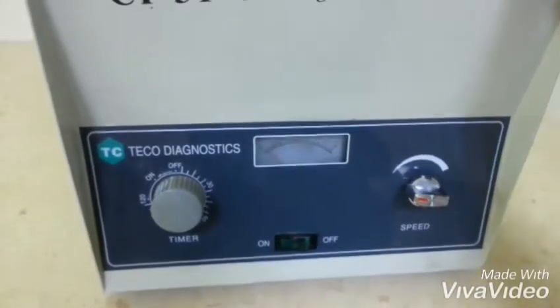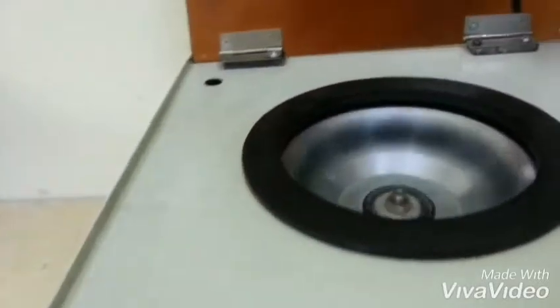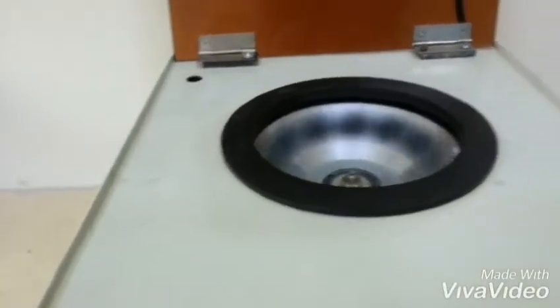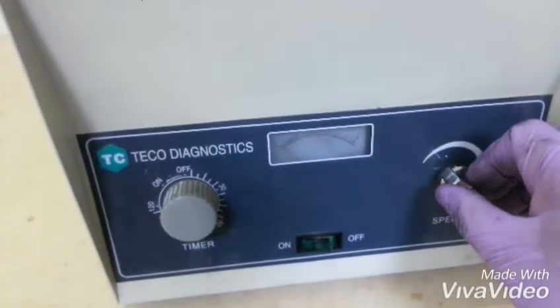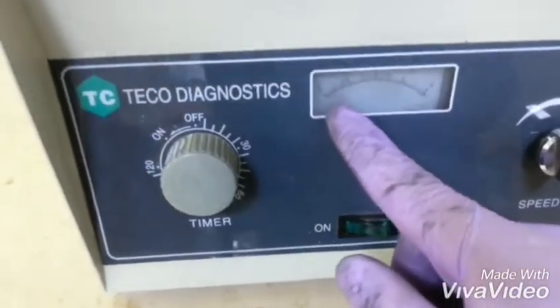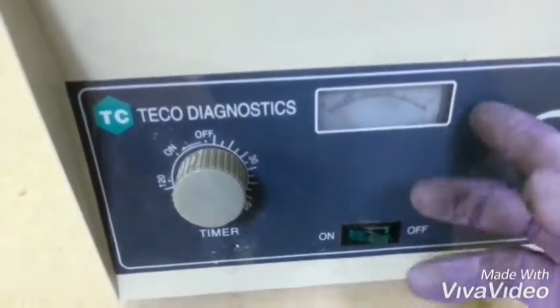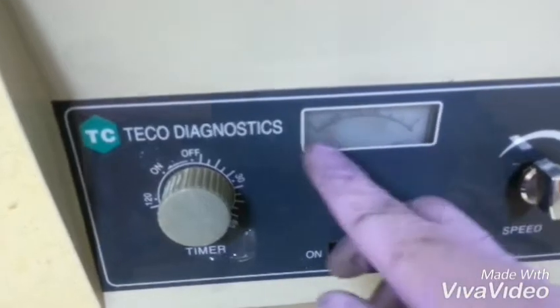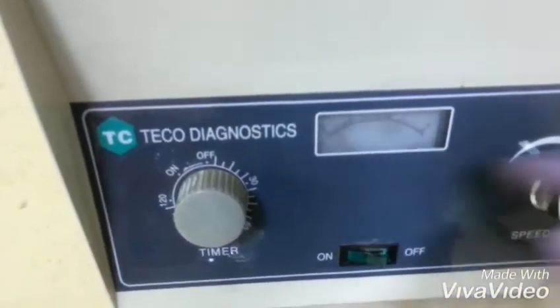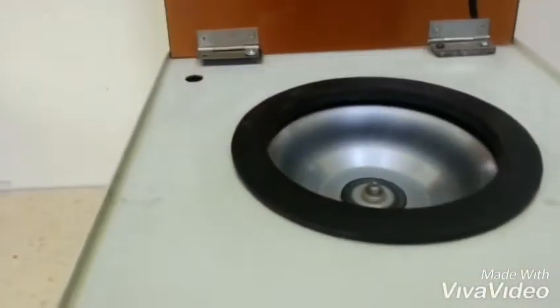InshaAllah. Okay. Adjust the speed. And then you can see the gauge there — set it to whatever desired speed you want, the standard or however fast you want this machine to run. It's working.